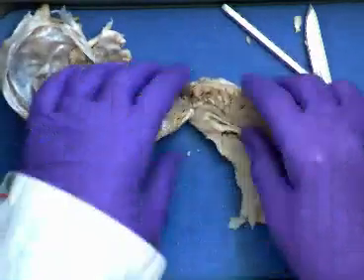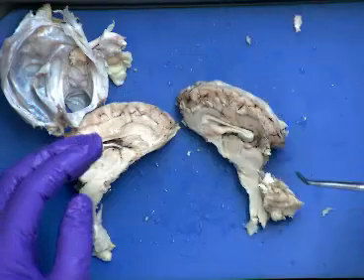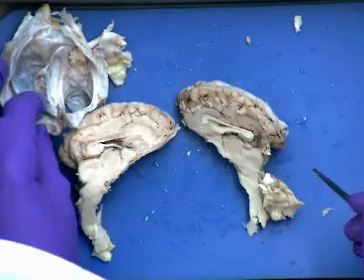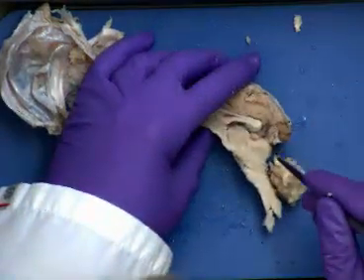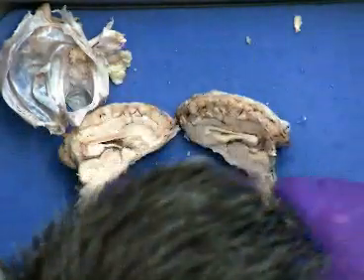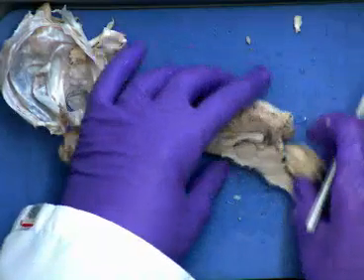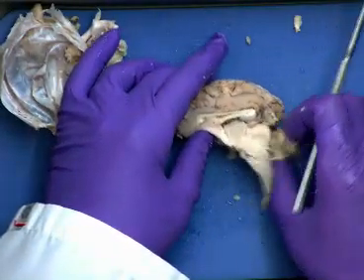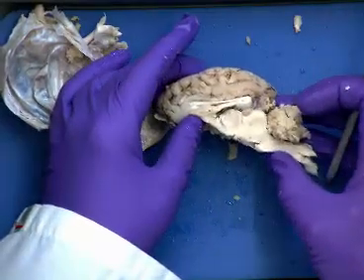Okay, so again, now we're getting a view that is somewhat similar to what we've seen on the models. My particular example here, for whatever reason, the one that I picked up, doesn't have a good cerebellum showing. So our cerebellum should be back in here. This is part of our cerebellum right here, on the posterior part like that. This is one half of our cerebellum, and it'd be right associated with our brainstem like that.